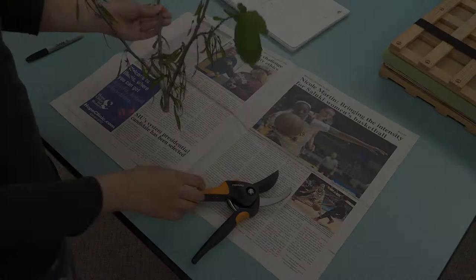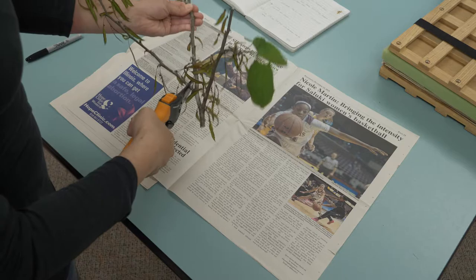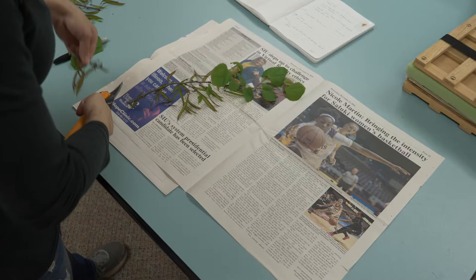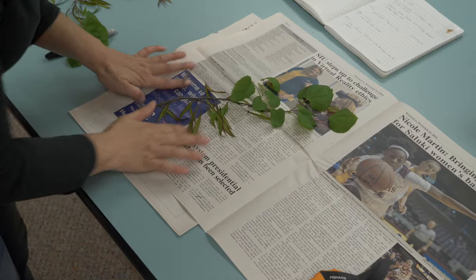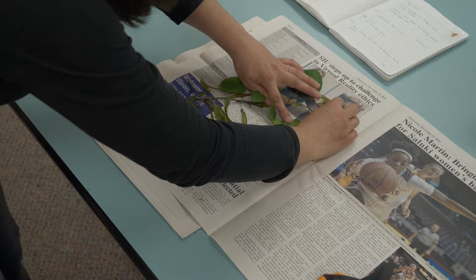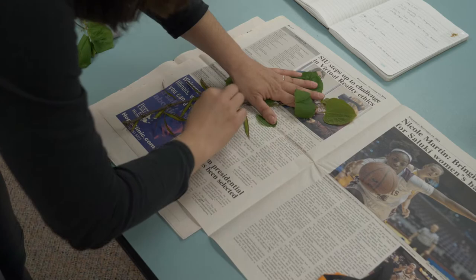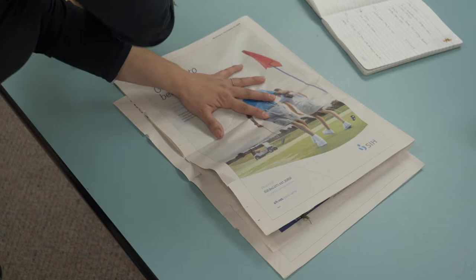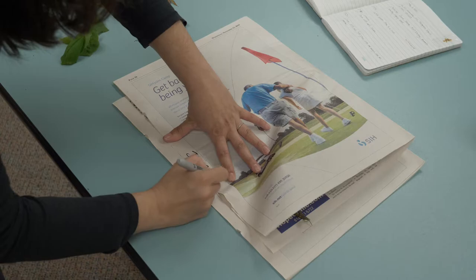In this case, we have a three-dimensional specimen. So let's clip a piece for this sheet. It's kind of big, let's remove a little bit here and distribute it nicely. You see, it's not totally flat — I don't like that. So when we press it later, we're going to add a foam to get it very flat. I think it looks nice so far. Don't forget the number.